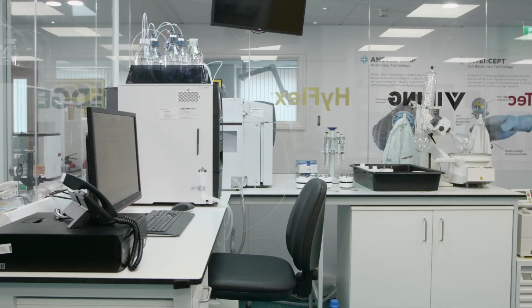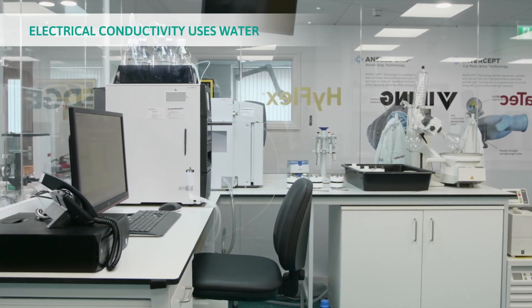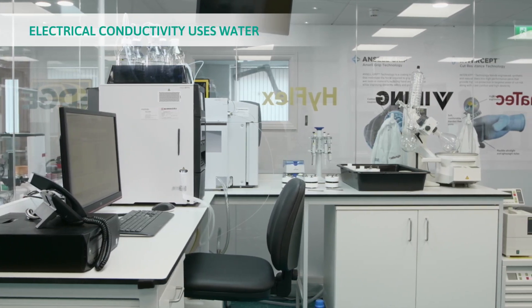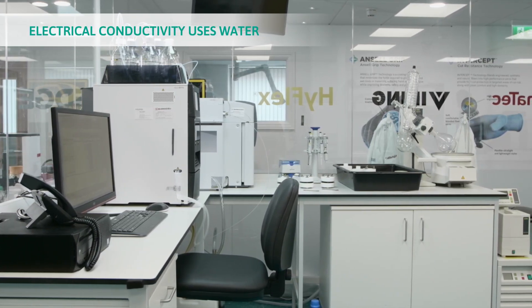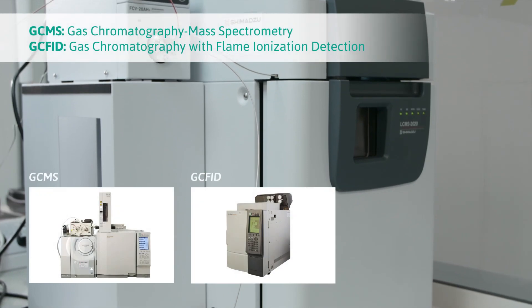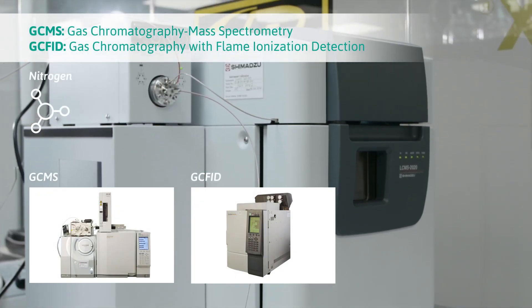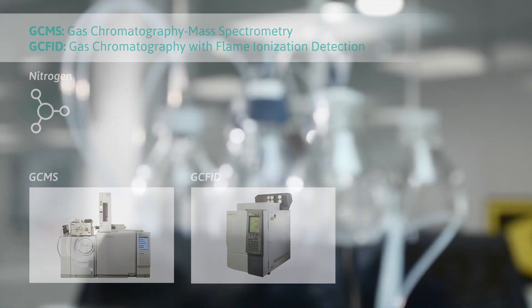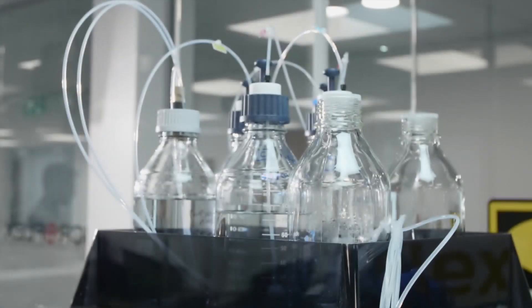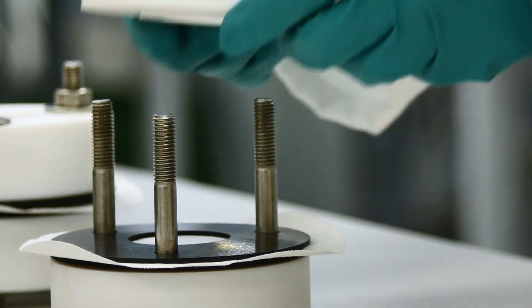The final detection technique we have in this lab is the LC-MS. Where the electrical conductivity uses water to collect the permeated chemical and the GC-FID and GC-MS typically use a flow of nitrogen, for using this technique we use a solid collection media.